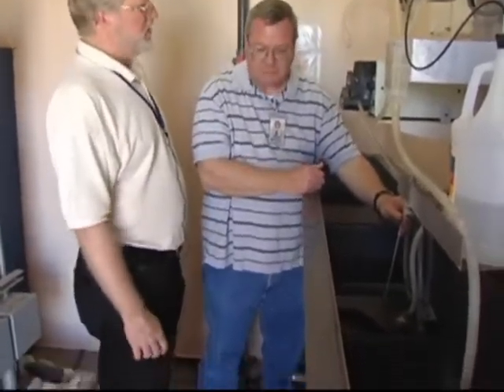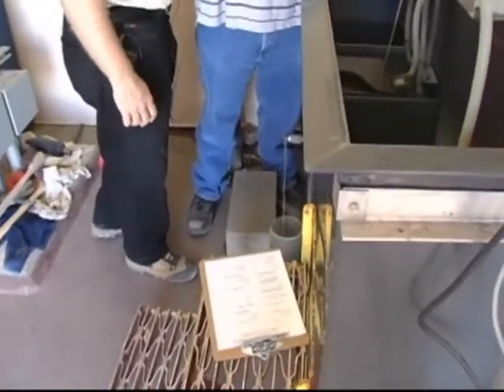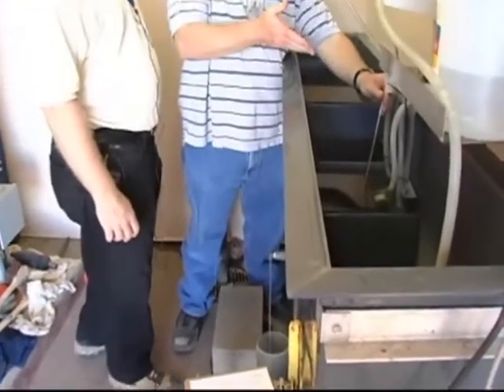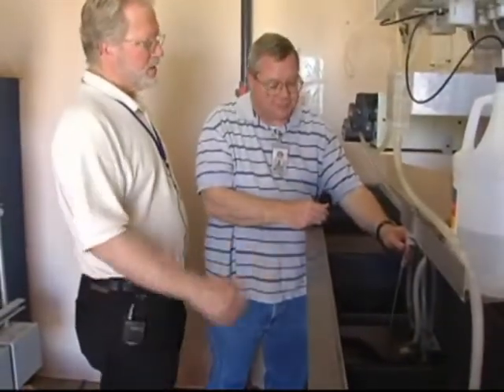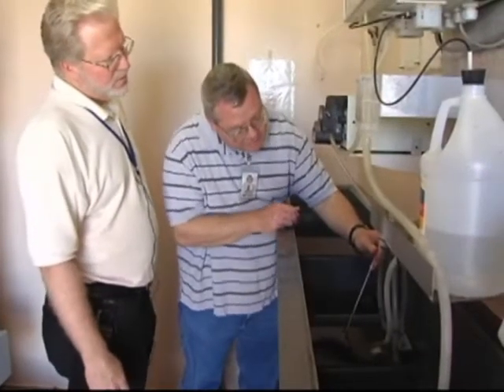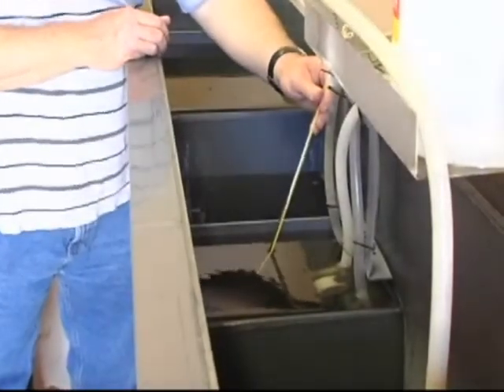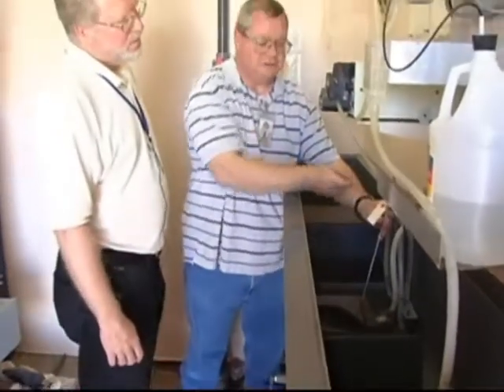And I see you have your records here — so you write this down immediately? Immediately, yeah. We write this down right away, just on that sheet here. As soon as we see our temperature, we write it down, and then we do a loop again and write it down again. It's stabilized pretty good. I'm seeing 28.8, and it's got a correction factor of negative 0.3, so we'll call it 28.5. That's what we call it for today.